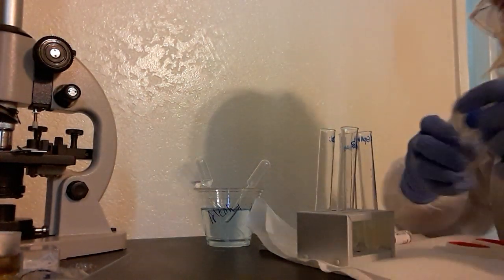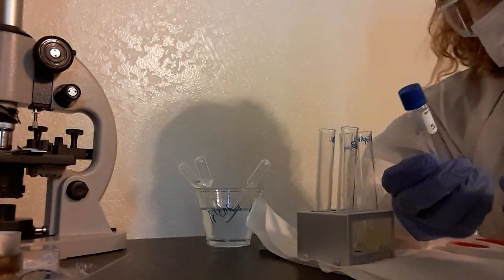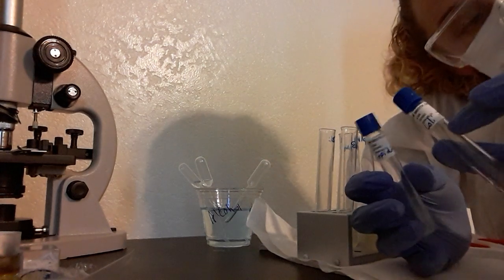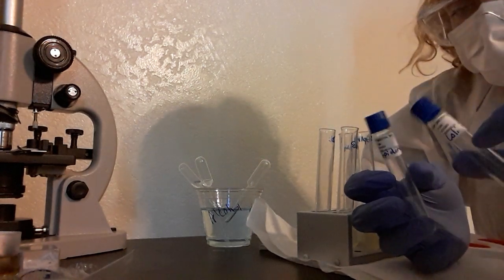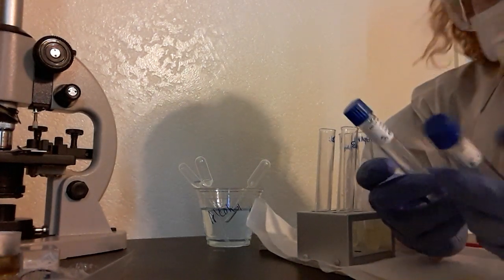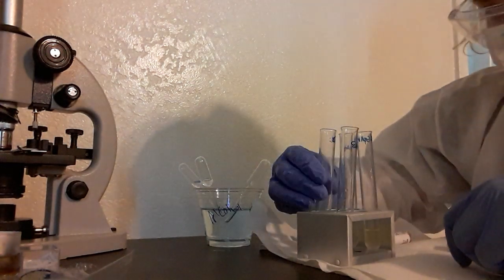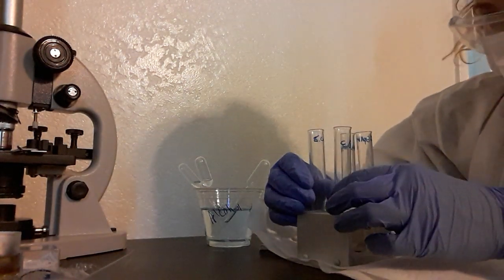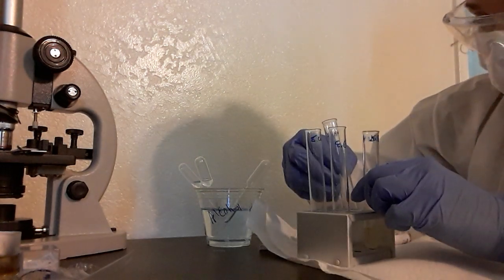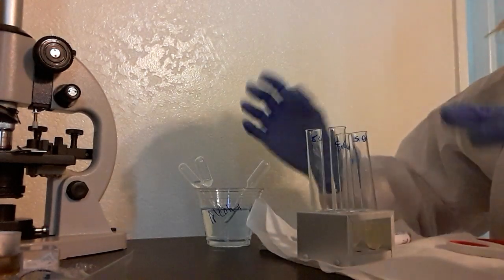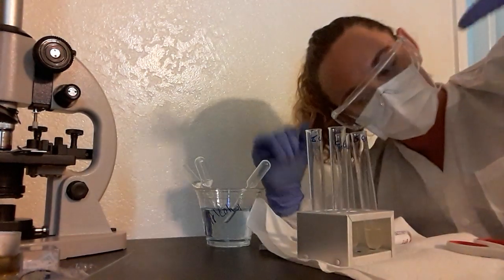I've already got my MRVP broths, which have 0.5% glucose in them, and I've let the cultures sit for 48 hours. I've distributed them evenly in my E. coli and my S. epidermidis test tubes, which I let sit in alcohol and dry off. My work area is clean, I'm wearing my PPE.